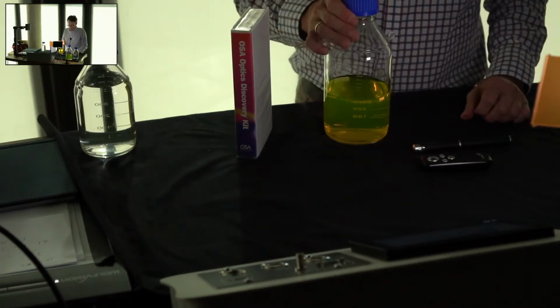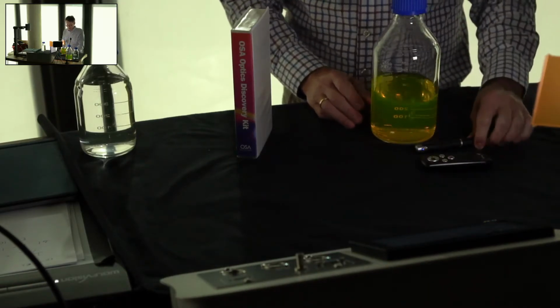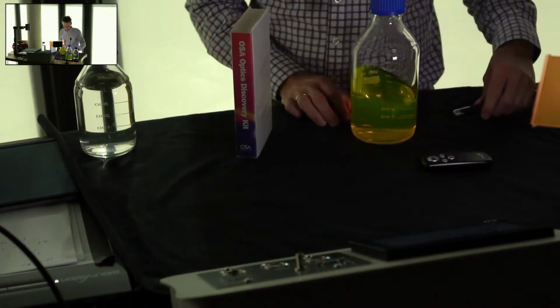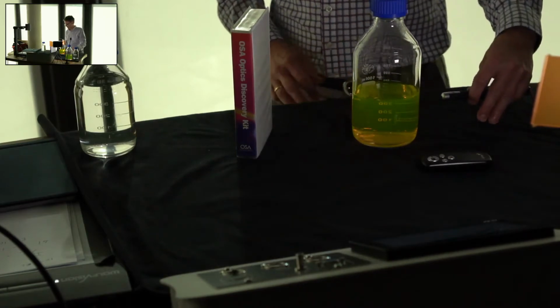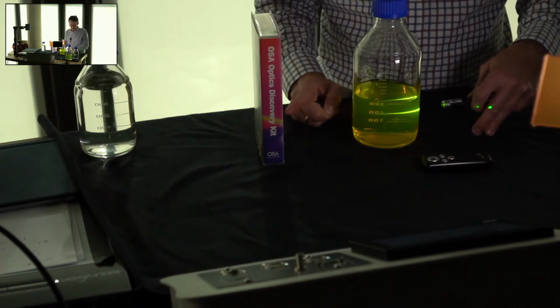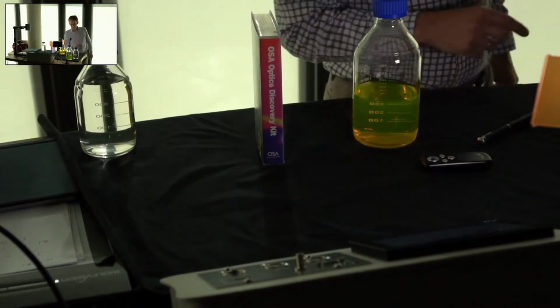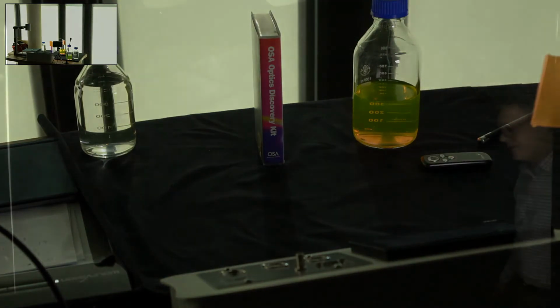I would like you to do the following. Let us assume we have a dye solution like this, and let us assume that there's some green light still coming through, and I'm going to the blackboard over there, not the blackboard, this fluorescent light board. Let me go to that, and let me just write this down. So why don't you calculate what the concentration of the sample is?